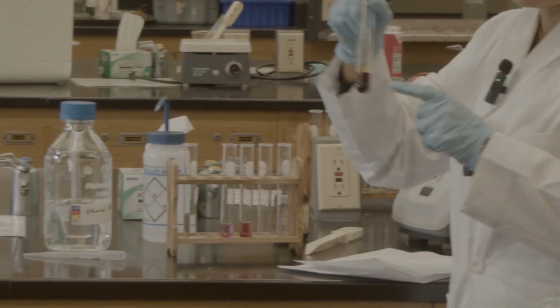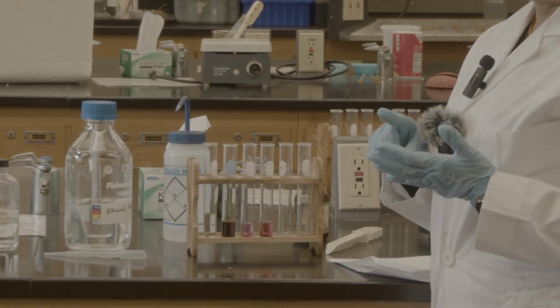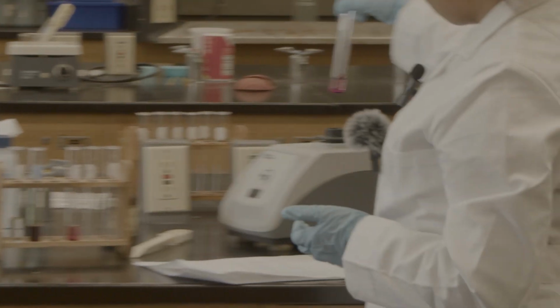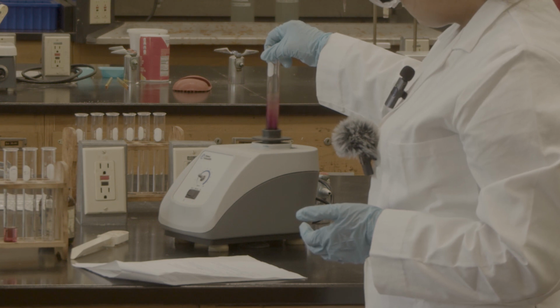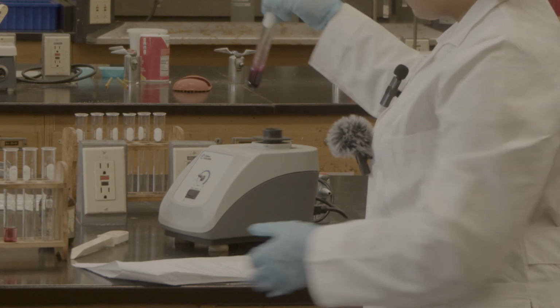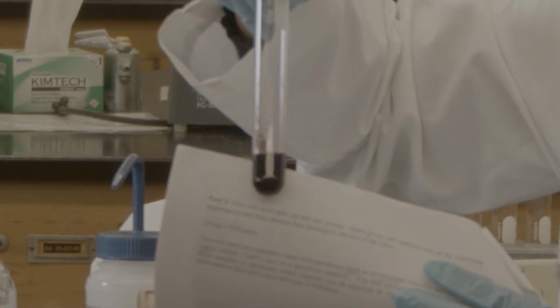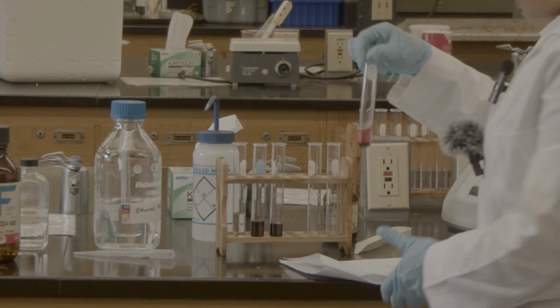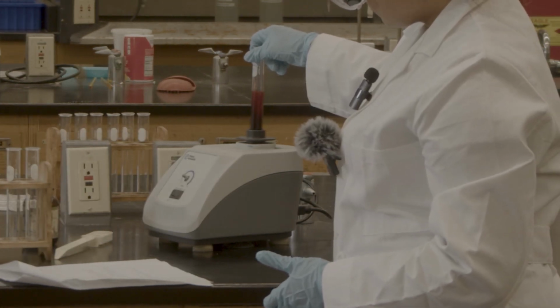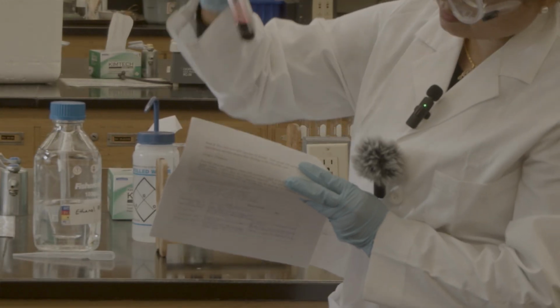So as I said, this is partially non-polar, because CH3, CH2 are non-polar, but the hydroxyl is polar. So that's why it's partially dissolved. This is with the chloroform. It's totally dissolved. I don't see any chunk. Okay, it's with the toluene. Also, you can see it's totally dissolved.